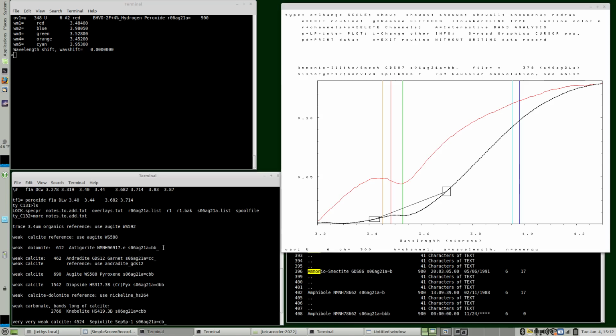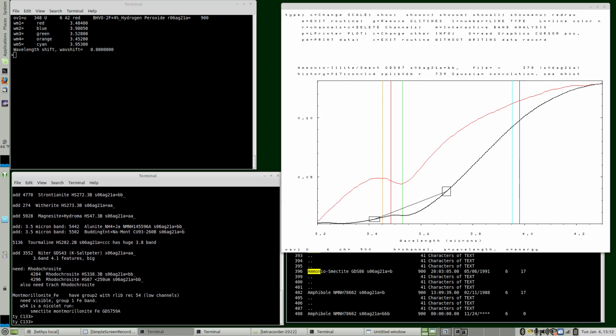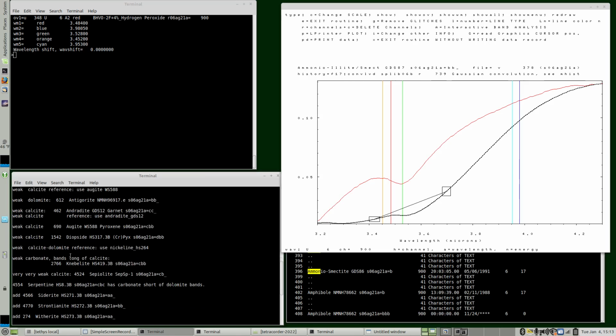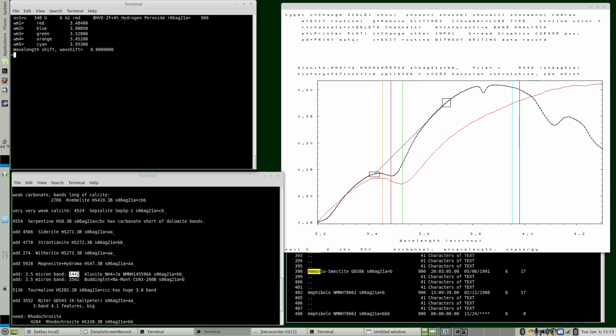So I had marked a few down here. I guess I didn't put in as many as I thought I did. Oh, yeah, here we go, these. Okay, let's look at this one. So that other one was shifted a little bit longer. This one's shifted a bit shorter. And since we only have one feature like this, anything that's close will probably match.